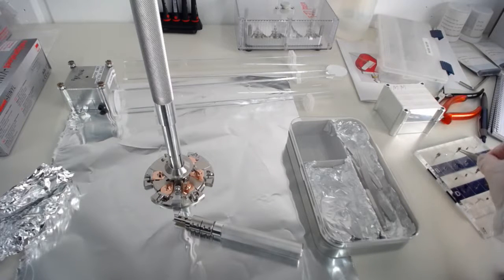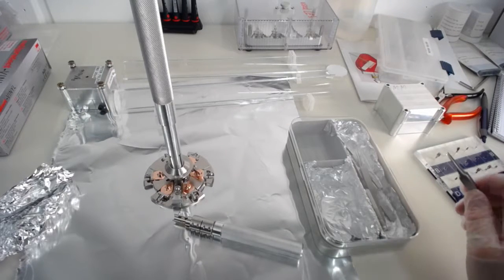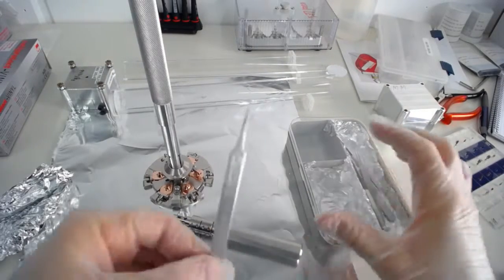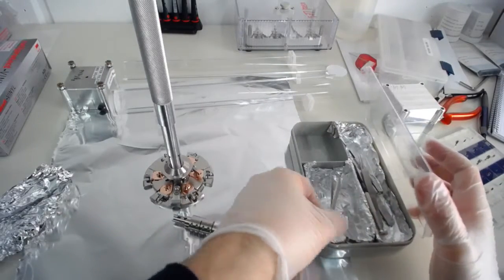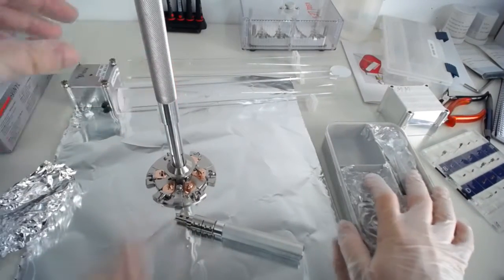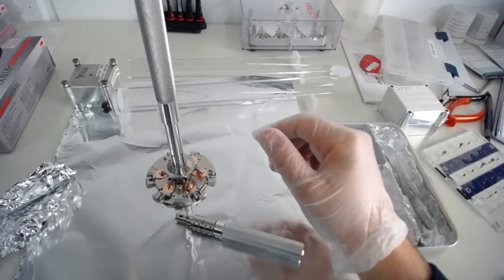For one reason that I can do TEM, or mostly actually STEM. So in a focused ion beam system, they've got a setup where I can do scanning transmission electron microscopy while I mill. And so you need a sample where you can look through. We've also got a little specimen retainer, some of those where we can use electropolished samples, we can screw in electropolished samples. But if you do a project, we'll probably have a conversation about how to best do your samples anyway. These are the different options. And this is how you can fix your different types of samples.